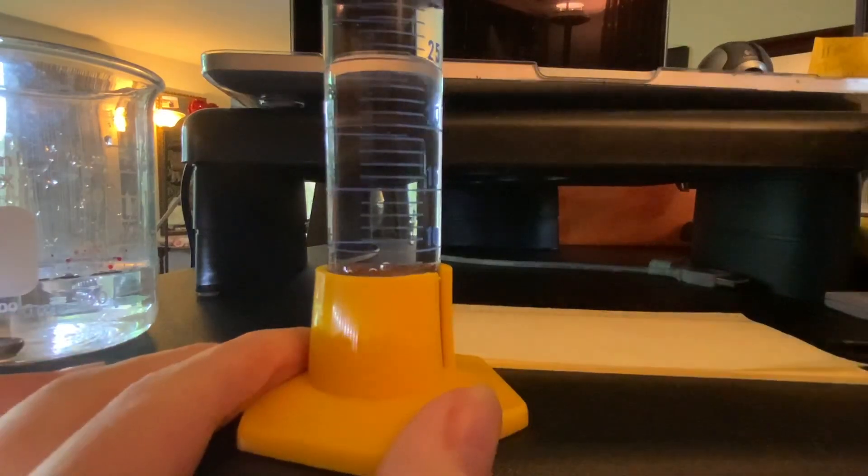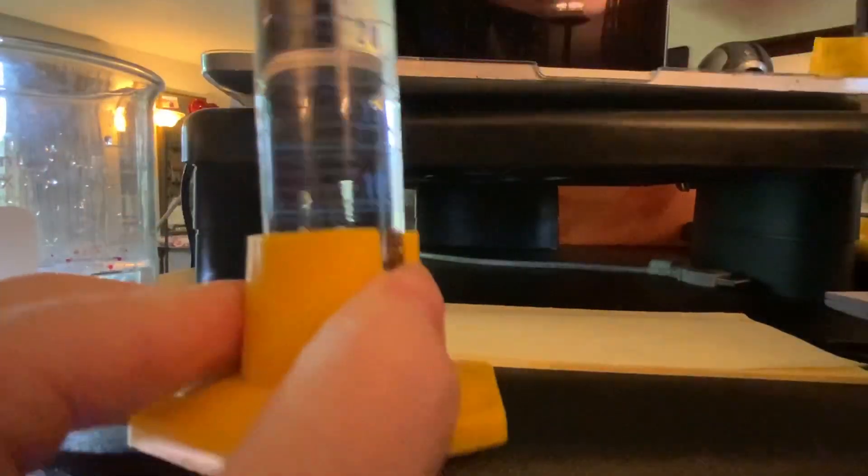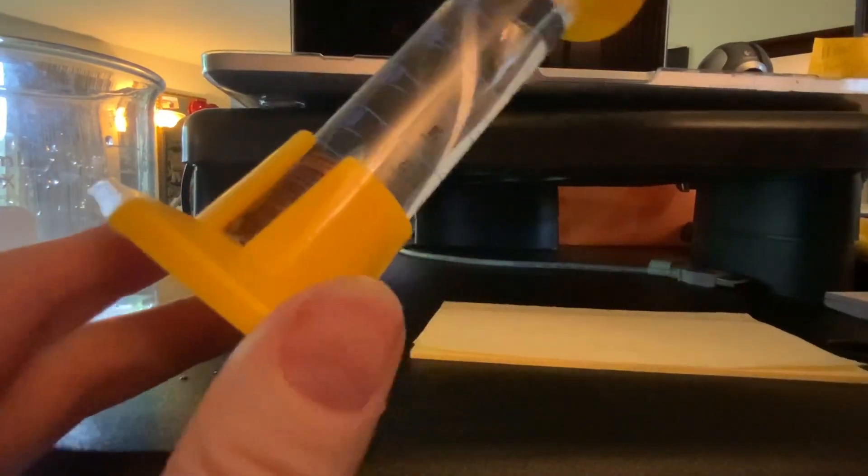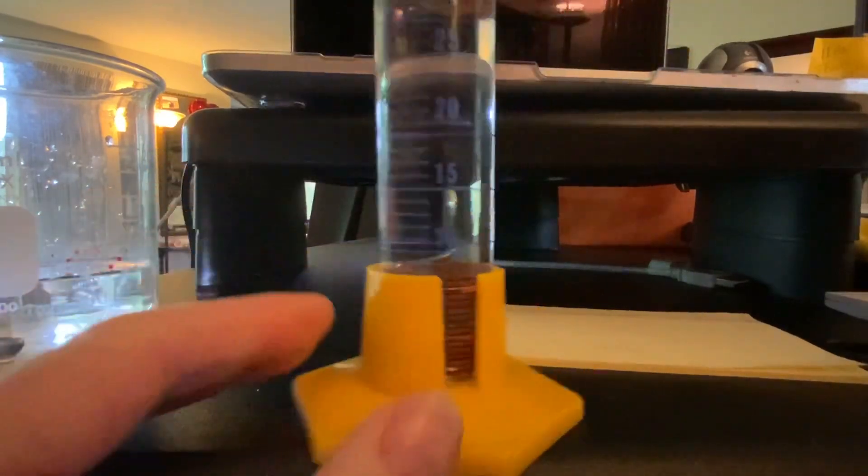Alright, oh a little bit of air. I'm just gonna shake it around, try and get those air bubbles to come up. Alright, looks all right.